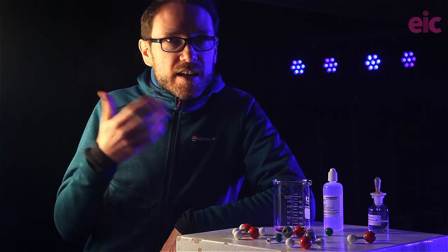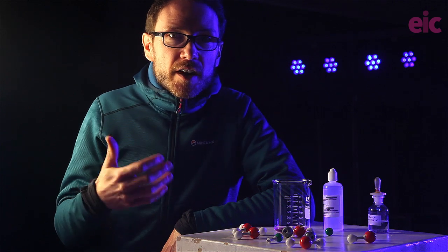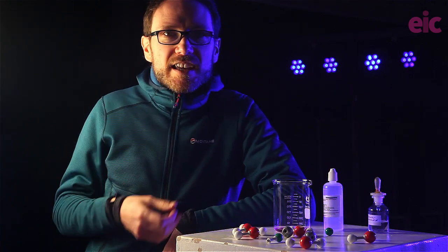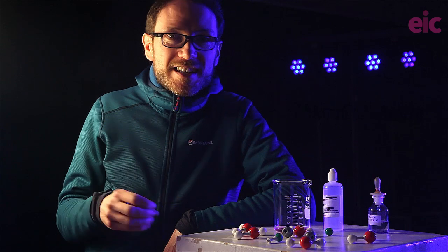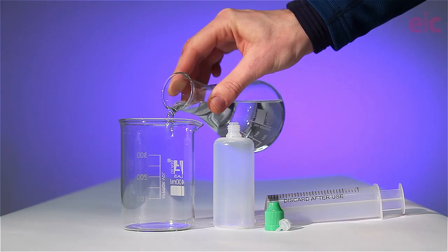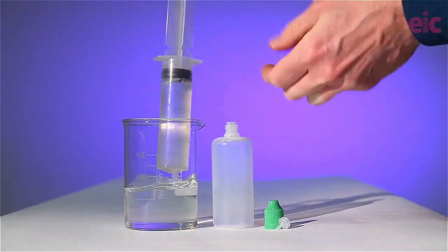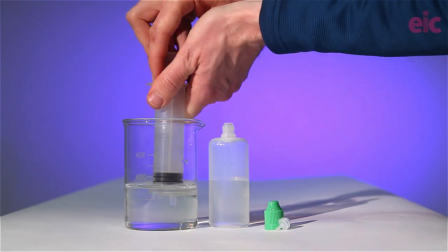As we'd already had a bottle open for a while before the pandemic, making up a solution in late 2021 was a real problem initially. On the plus side, you get to see just how bad old stock actually is — cloudiness before filtering can make it seem like your hydroxide is a lot more carbonated than it actually is. We used squeezy dropper bottles holding about 100 mL, which are fantastic for microscale work. Mattson-sized syringes help load them up quickly.